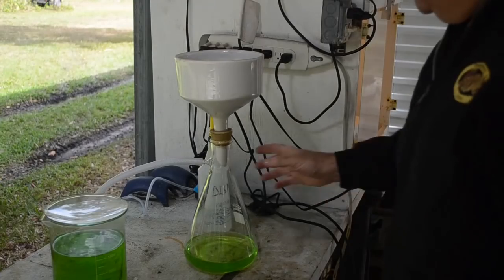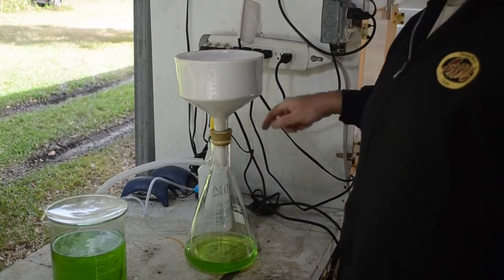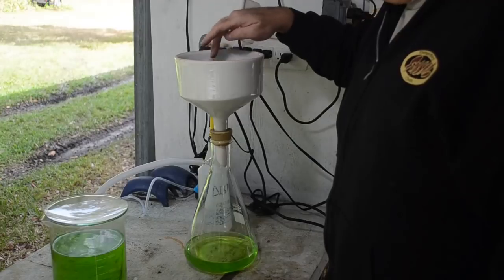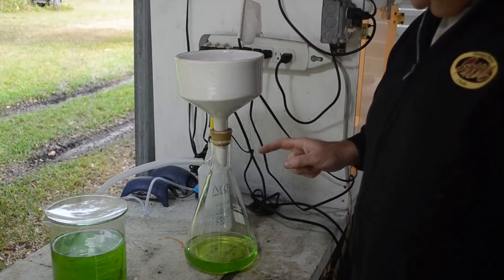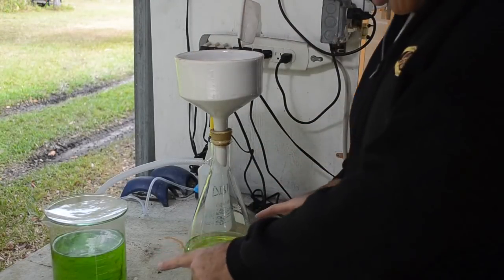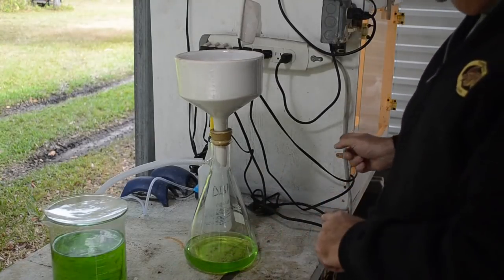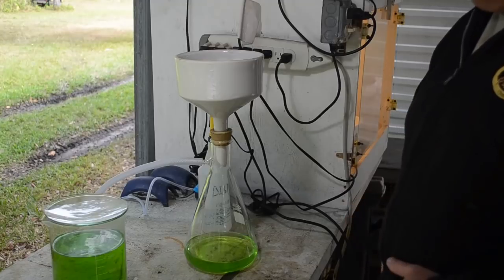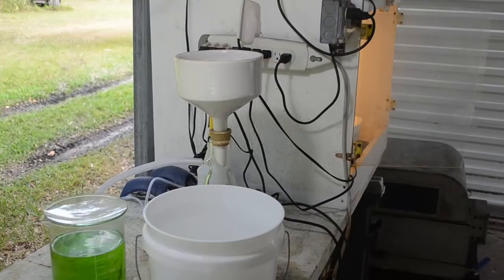Okay, I've had the vacuum running on this for about 45 minutes or so. The drops are pretty few and far between now. This is quite dry up in here. So I'm going to call it. I'm going to dump the liquid in both of these beakers back in the big 3-liter beaker, which I have cleaned, and put it in a fume hood, and we'll drop the gold. Hopefully we'll get a nice clean gold drop this time.